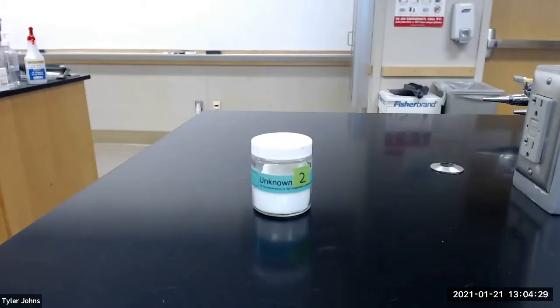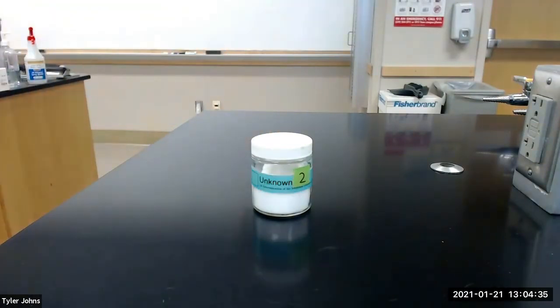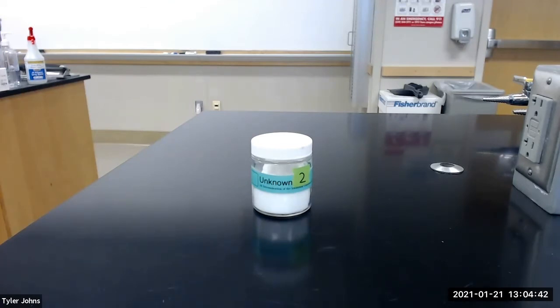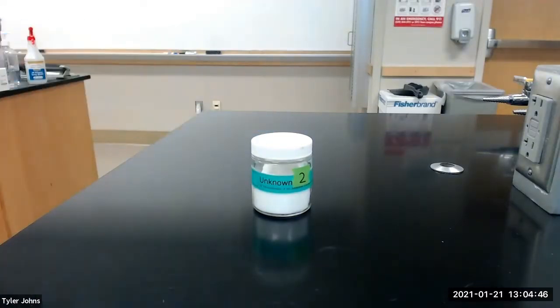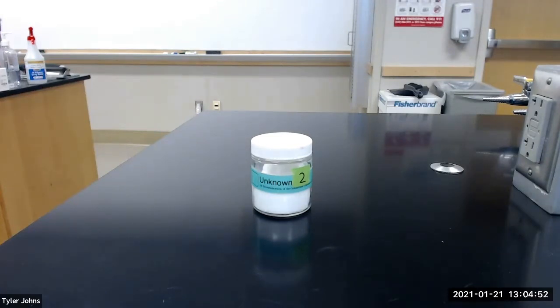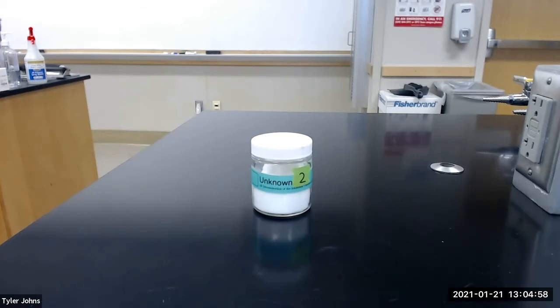For part two of this experiment, we will determine the pKa of unknown acid number two by plotting a titration curve and determining the half equivalence point. To do this, we will need to use the titration data from part one. We will need to calculate the mass of unknown acid number two that will require 25 milliliters of standard sodium hydroxide solution for complete titration. Use the following example math calculation to determine the exact amount of unknown acid that is needed.